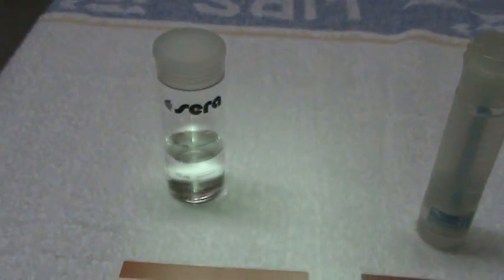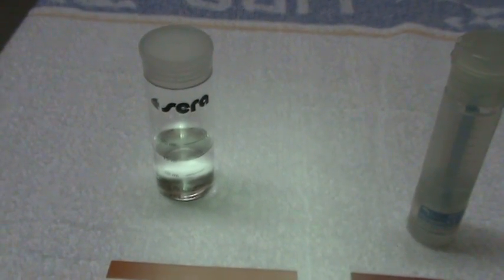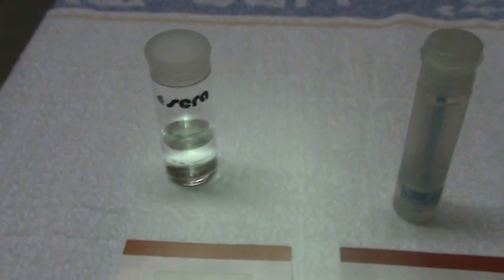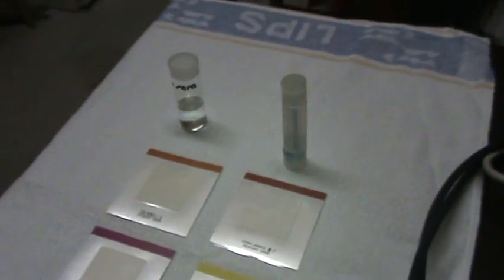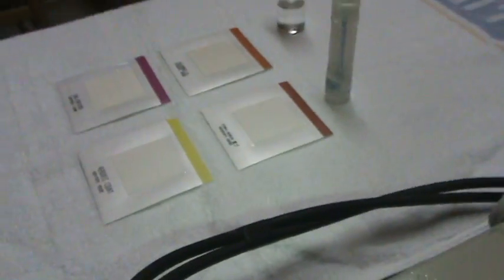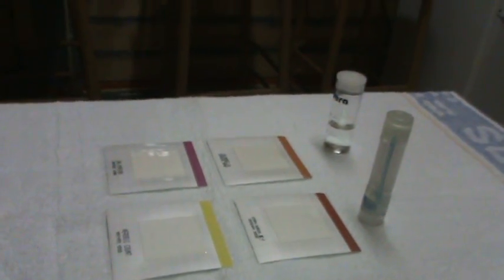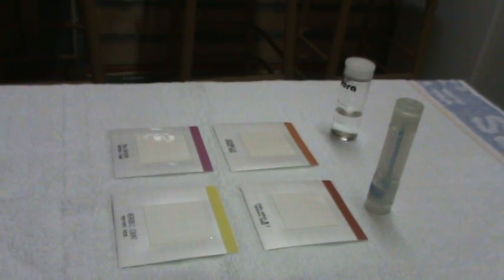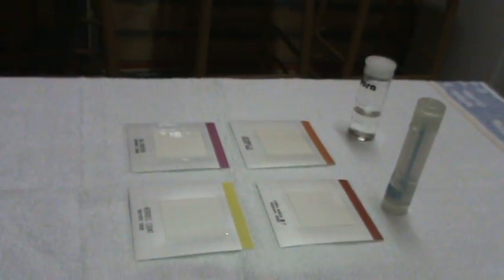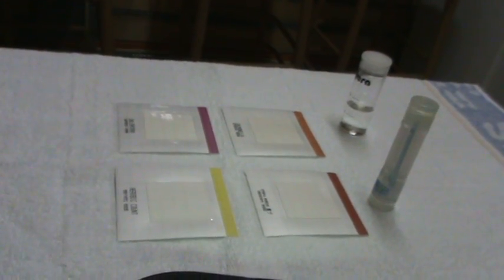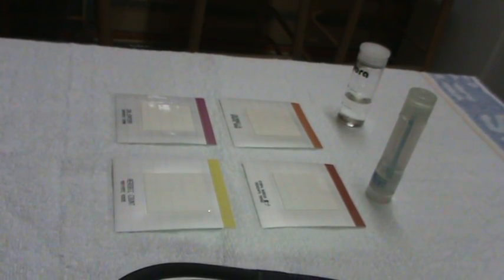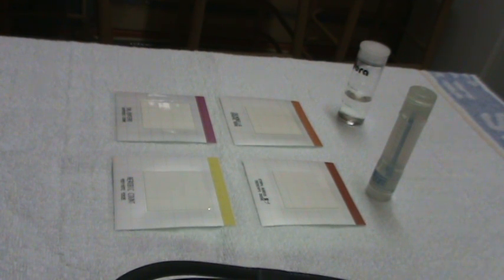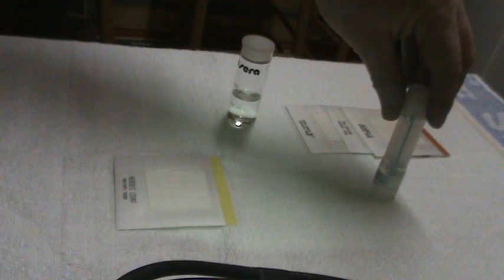You also need one swab and a sample of water from your pond. I am just going to put the camera down. I am hoping it will stay up and make some tests. This is sample water from my pond, about 15 milliliters. I usually do 20 milliliters.